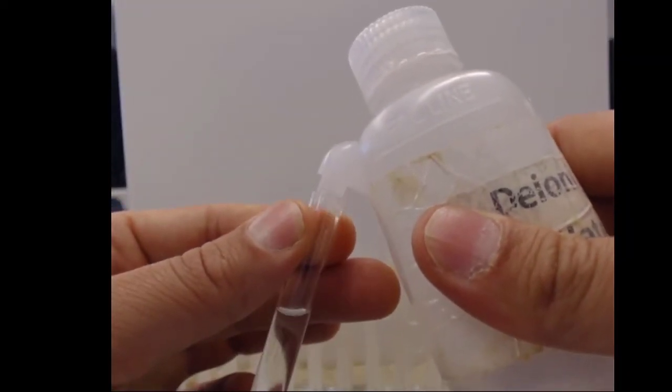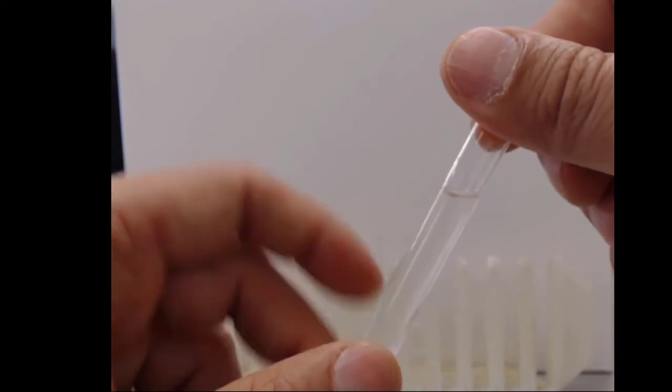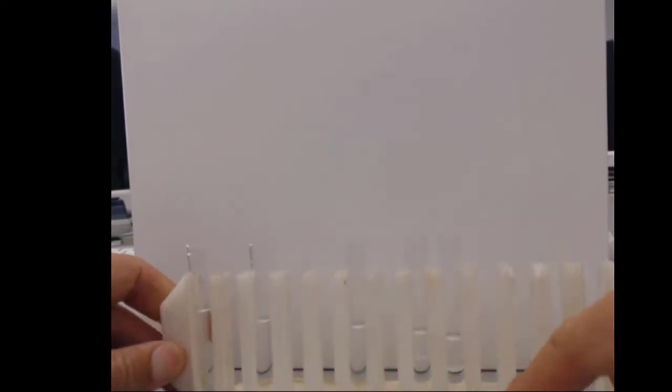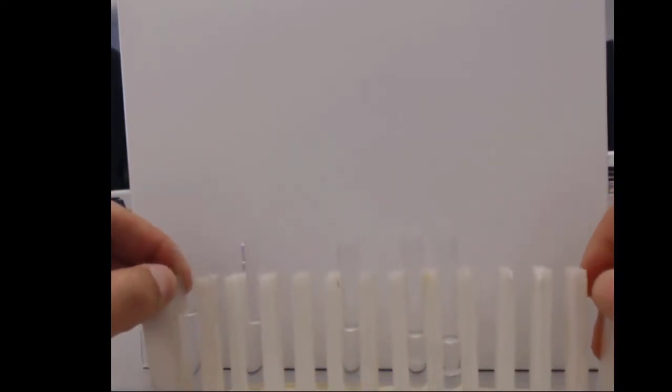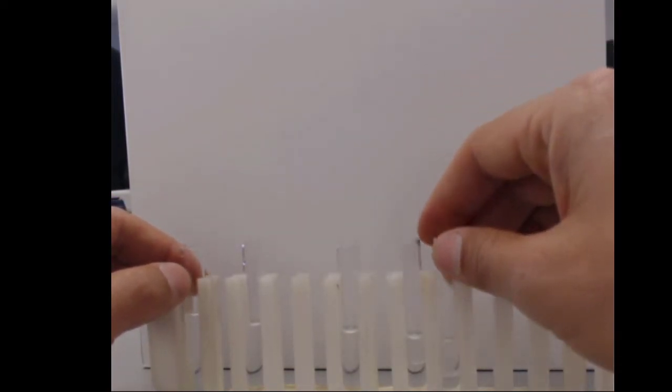Last one. Methanol. Oh, I put in a lot of water that time. Again, methanol, because the short carbon chain doesn't create enough surface area for the London dispersion force to overwhelm, the alcohol group will dominate in that case, and the water and the alcohol will mix. So here we can see how a change in chain length results in a change in surface area, giving rise to a more nonpolar compound.